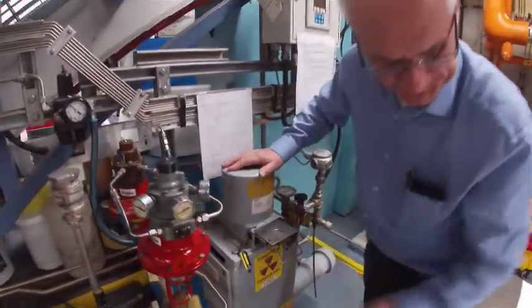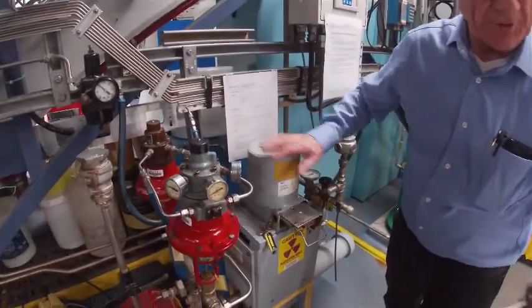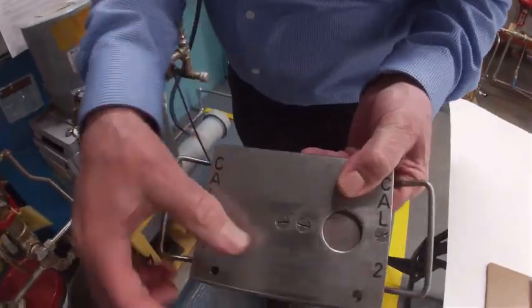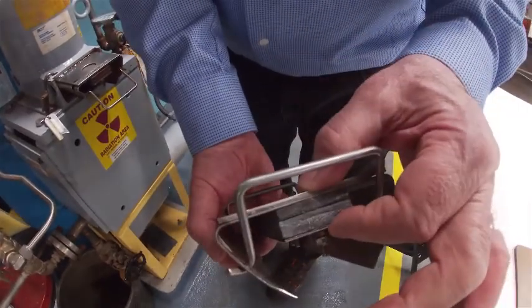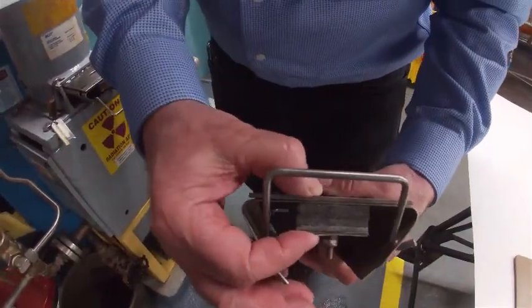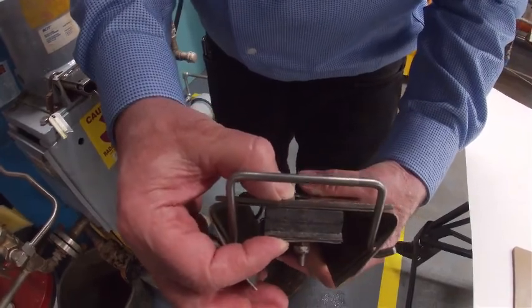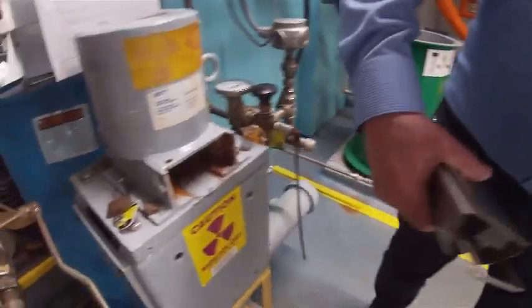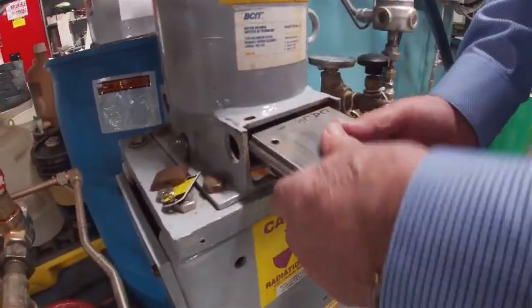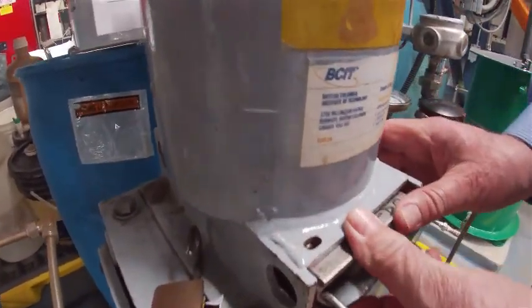The next step is to put in an equivalent absorber. These are equivalent absorbers — Cal-1 and Cal-2. They are blocks of lead that are simulating 70% ethylene glycol on Cal-2, and we're simulating 10% ethylene glycol on Cal-1. Pull the shutter out and replace it with the Cal-1/Cal-2 block. That's the Cal-2 position. If you want to go to Cal-1, you've got to slide right across and there's another hole over here — and that's where we're going to start: Cal-1.